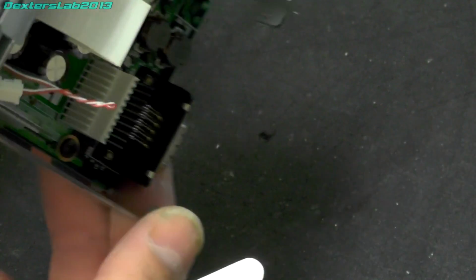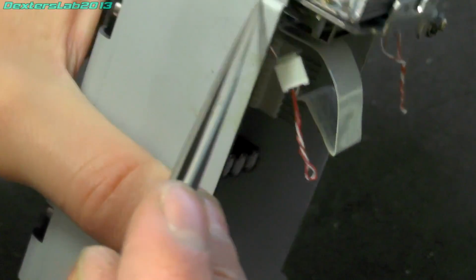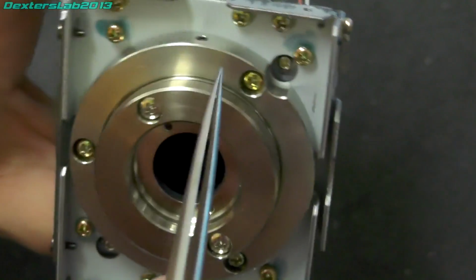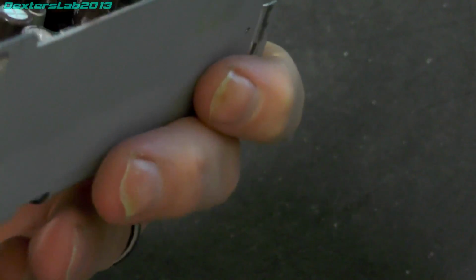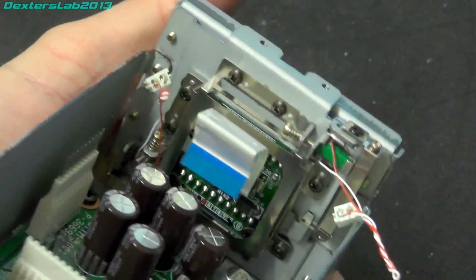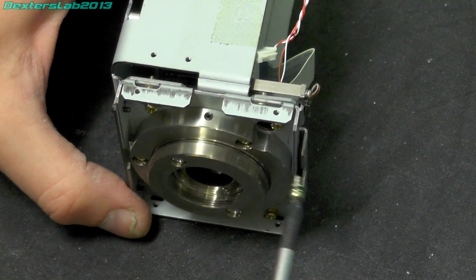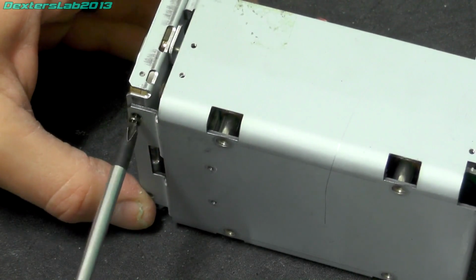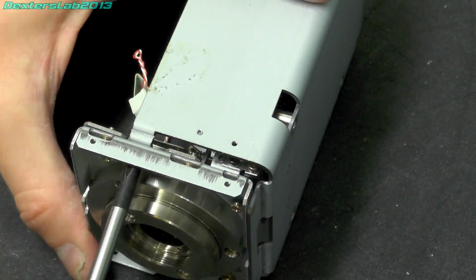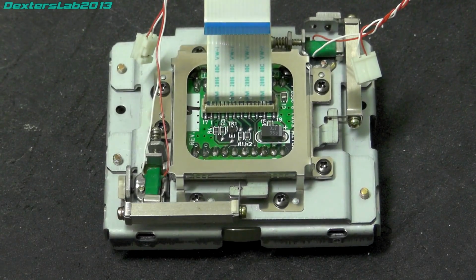So looking at this in a bit more detail at the front, it looks like it mounts there, and there. So I'm just going to take the whole assembly off, and then we'll have a better look at this structure that they've got going on here. Okay, so we can definitely see what's going on here.